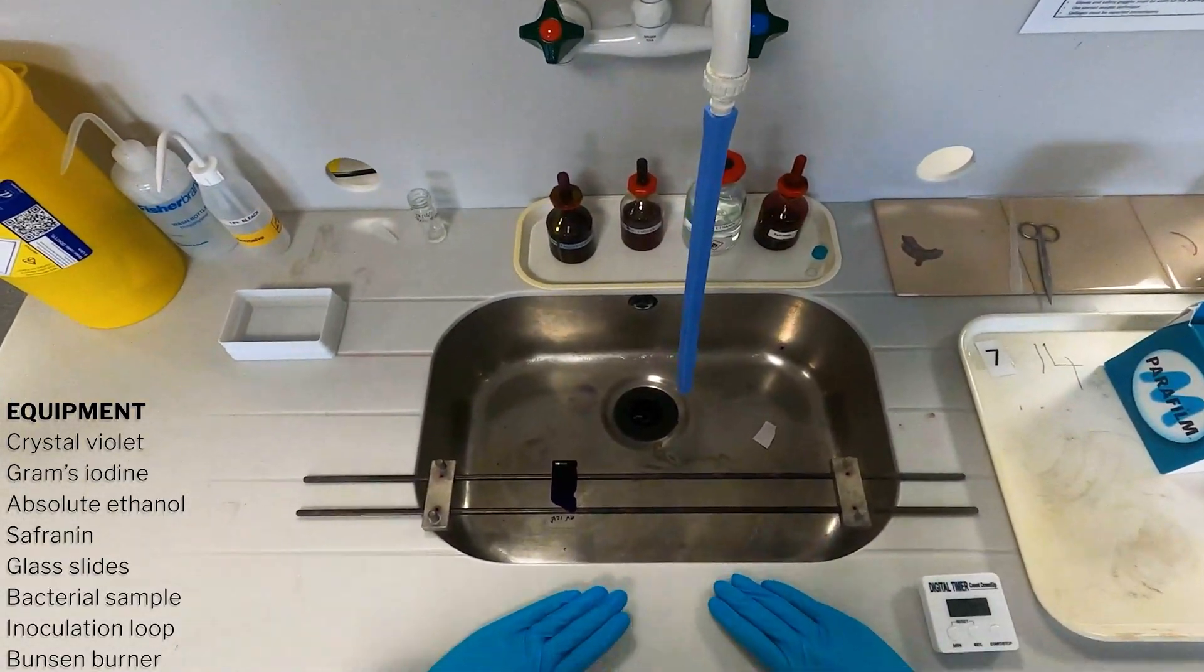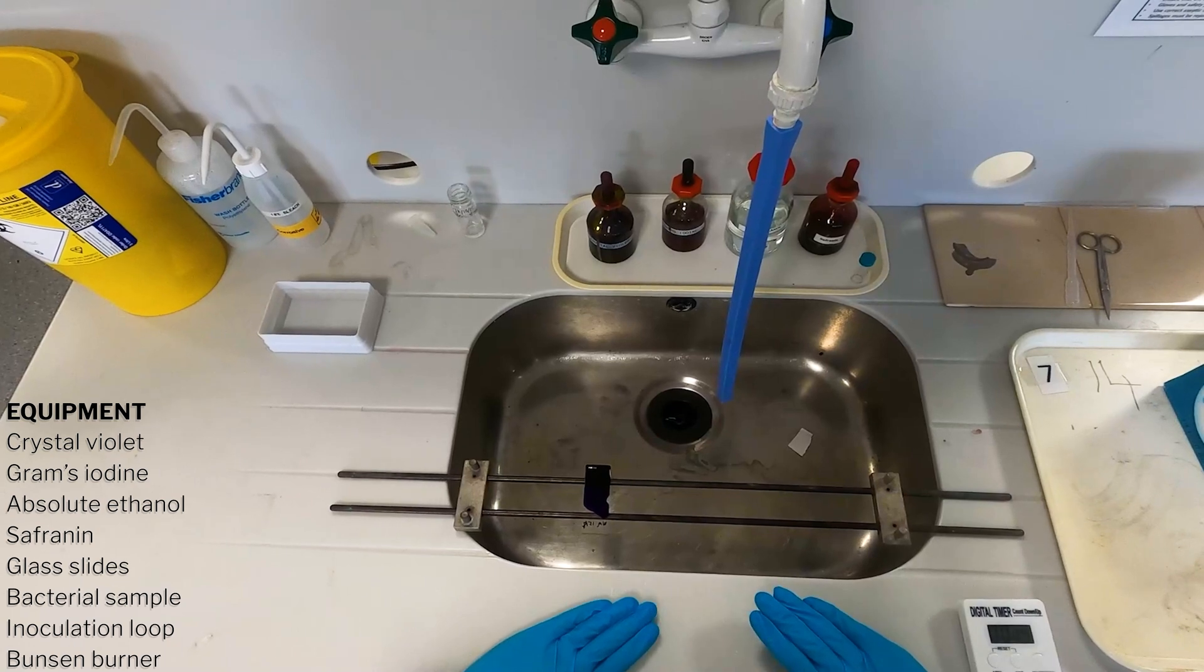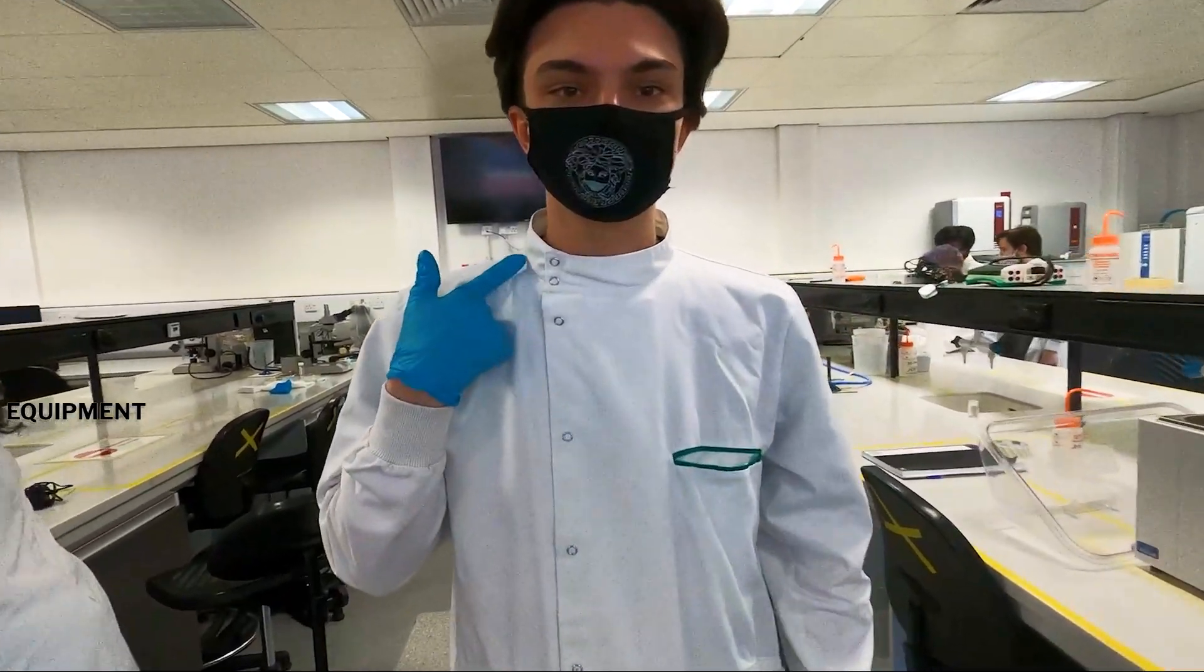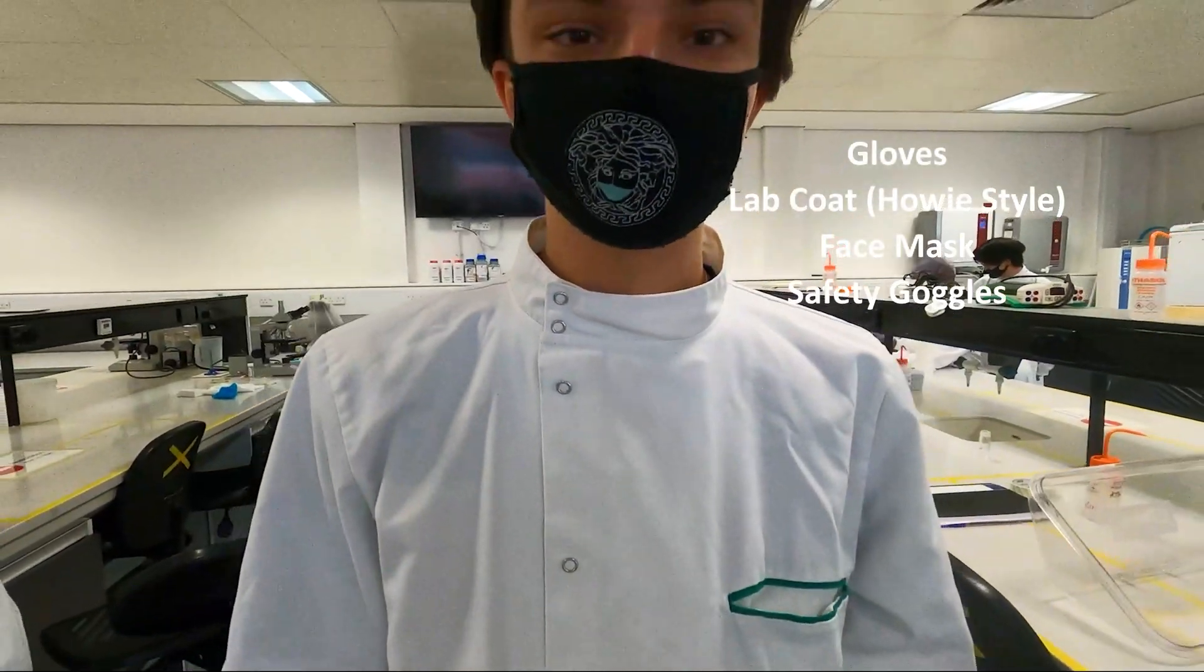The equipment list will appear on the screen now, so if you need time to read it please pause the video. Also you must have the correct PPE which is gloves, face mask, lab coat and safety goggles, which I forgot to put on in this clip unfortunately.